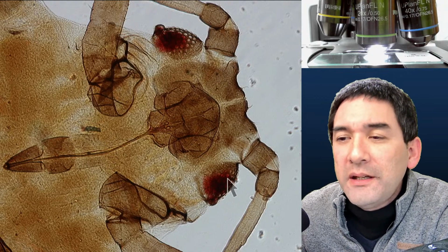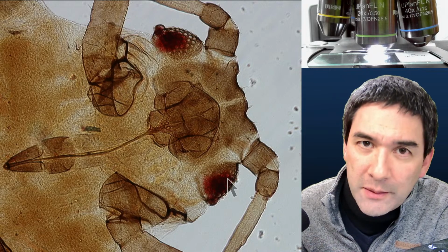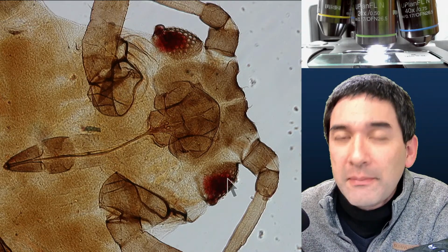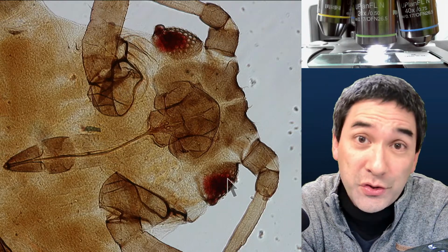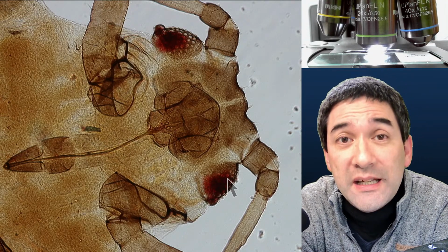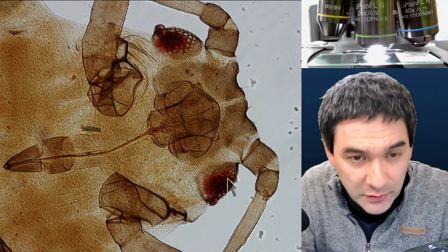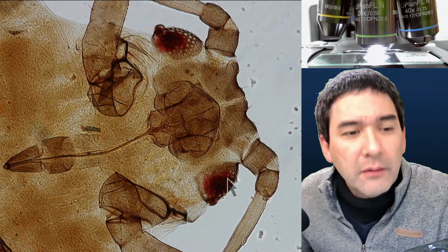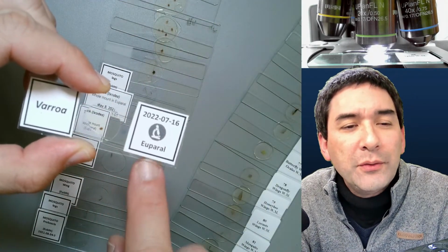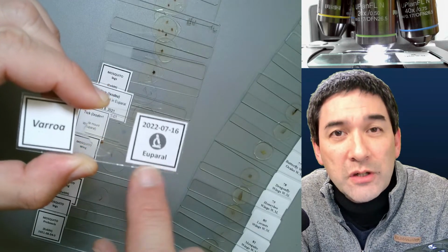Okay, what is another question for me from Marcel? What is, in your opinion, the best mounting medium for insects, if you want to make a permanent slide? That's an easy one to answer, luckily, because there is a mounting medium that is recommended, which I've also talked about before. For insects, the mounting medium of choice is called Euparal. I have it written over here, so you can see how it's spelled. Euparal mounting medium.